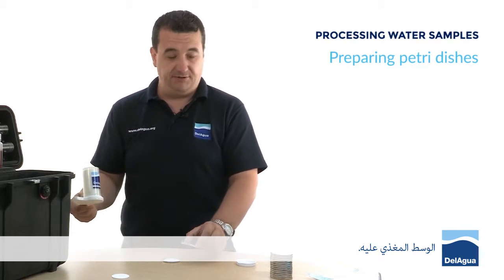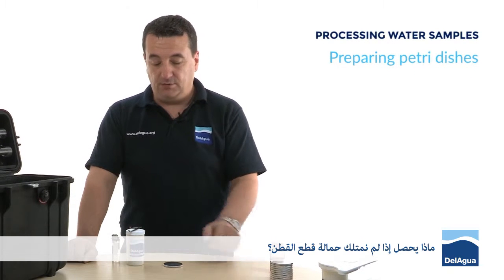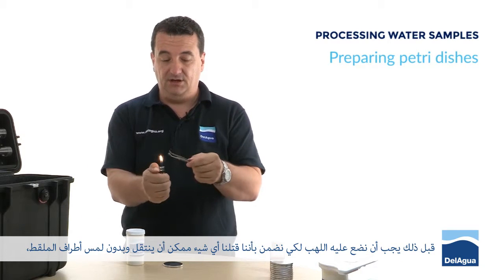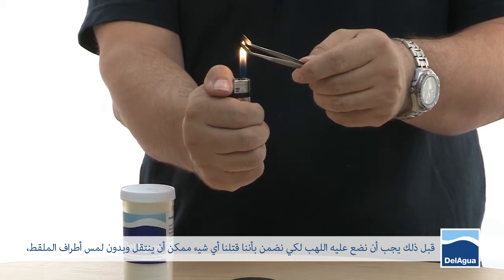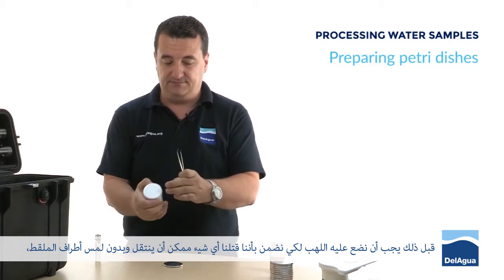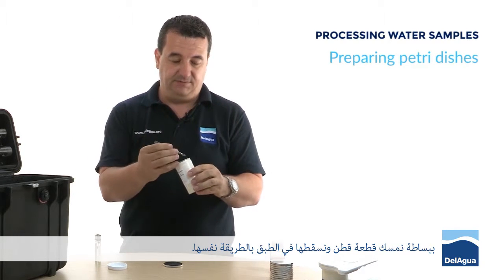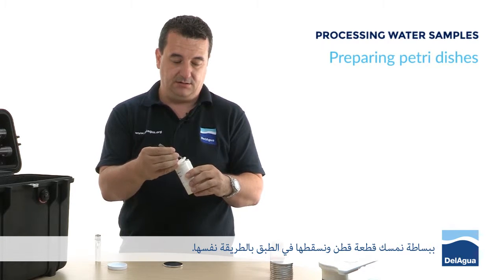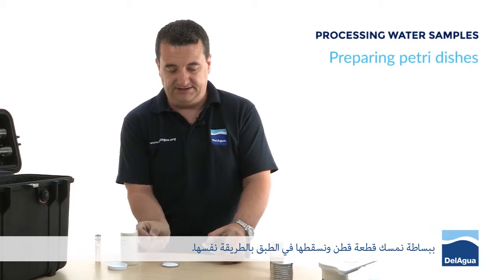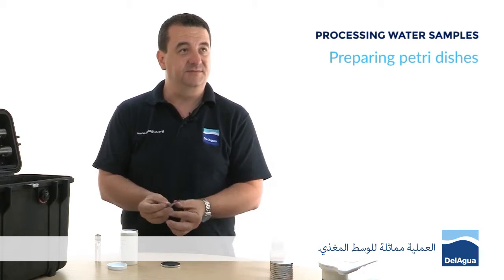That's ready for us to put some media on. Jeff, what happens if we haven't got a pad dispenser? We want to make sure that the pads remain sterile, so we can use a pair of forceps. If we flame the tips just to make sure that we kill anything that might be transferred, then without touching the ends you can very simply take a single pad and drop that into the petri dish — and it's actually the same process with the media from there.